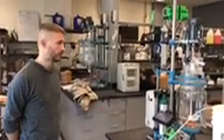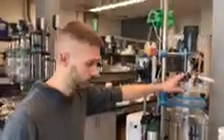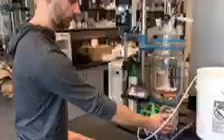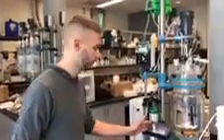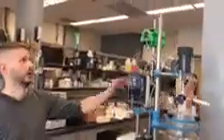So here is our smart bioreactor. It has a double wall glass jacket for controlling the temperature. We have a sampling system, which we will get into. We have an effluent pump and an influent pump, a data logger with control, the oxygen, an agitator with set speed, a high alkaline pump, and a high acid pump.